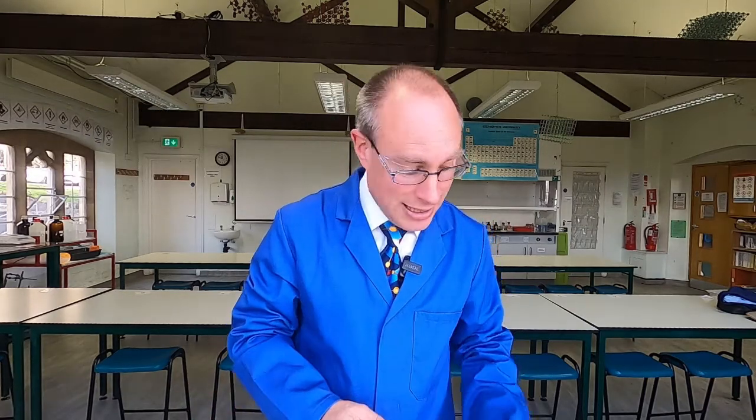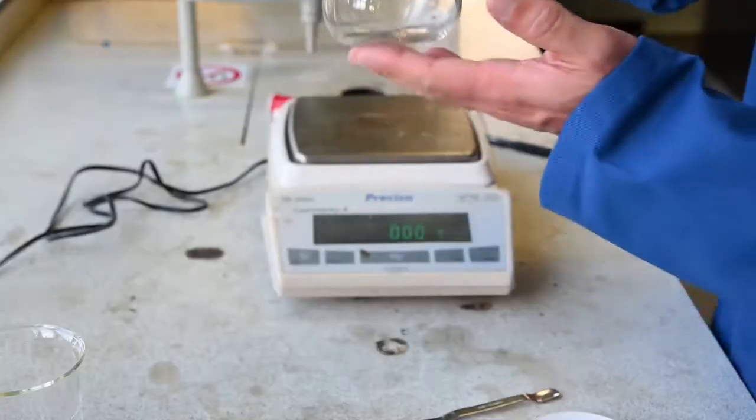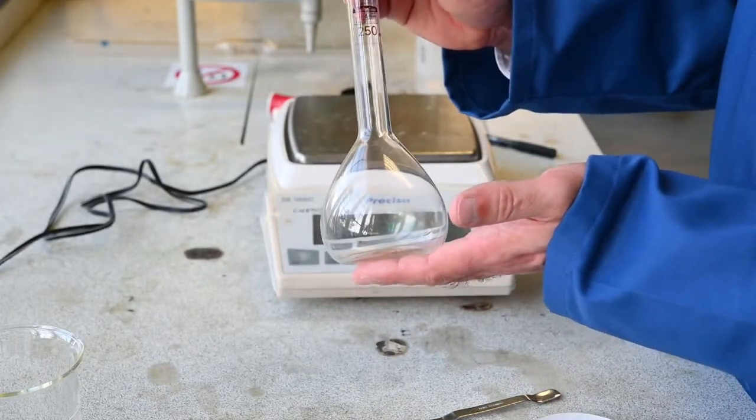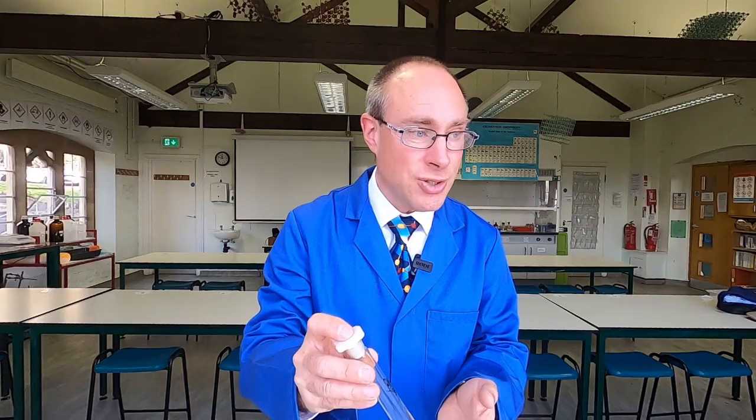So today I'm going to make a solution of the substance ethane dioic acid — hydrated ethane dioic acid. We're going to weigh a known mass of that solid; I've got some in this pot here. I'm then going to dissolve that in some solution and then use this piece of apparatus, which is called a volumetric flask, to make the final solution.